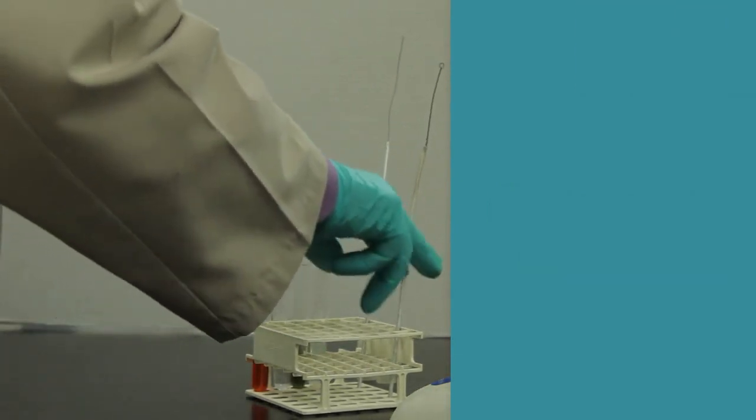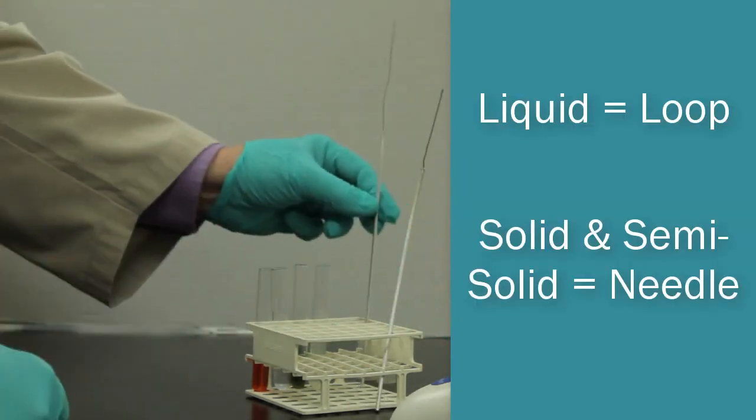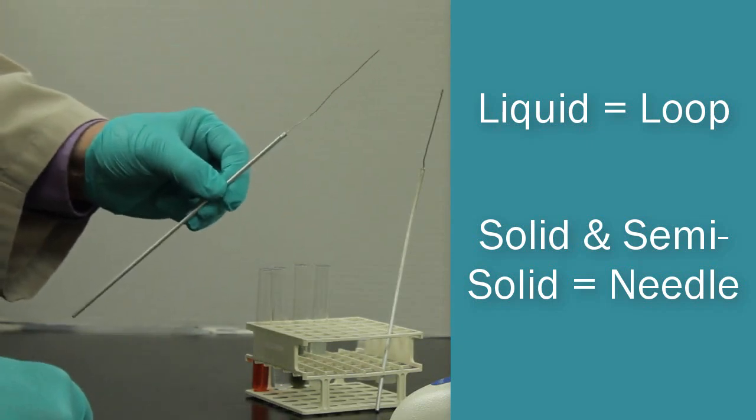A good rule to remember is if it's liquid, you're going to use a loop. If it's solid or semi-solid, you're going to use the inoculating needle.